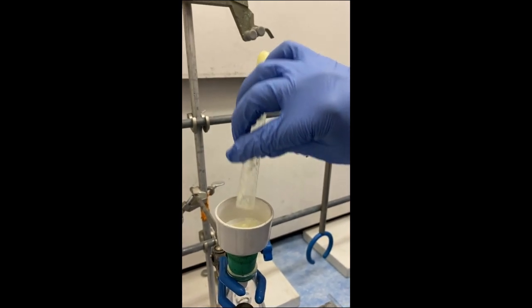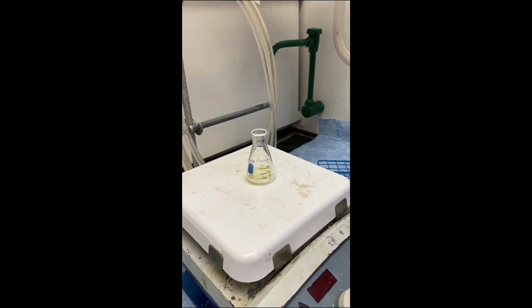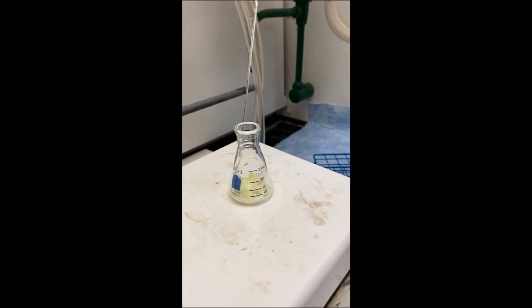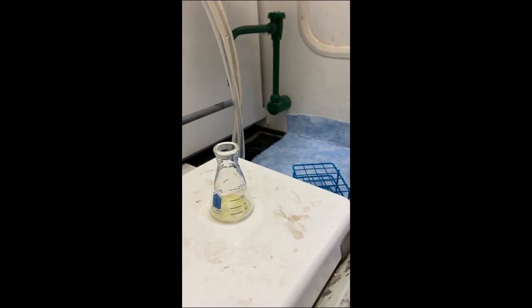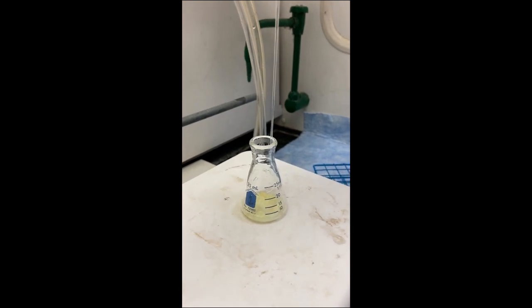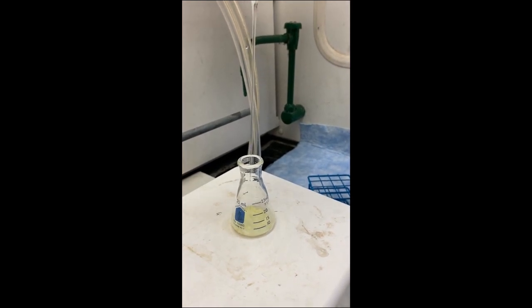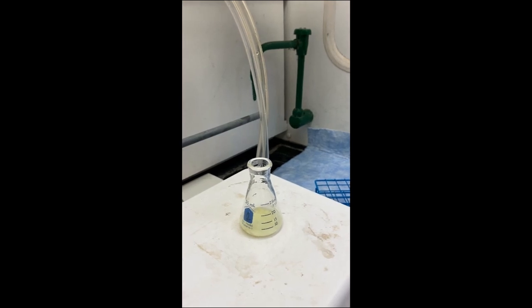Because it can go into solution. So we're going to start the recrystallization process — we're going to heat this up. Roberto's going to add some ethanol, probably close to a few mLs. Again, this is more art than science. We're going to heat it up, get it to dissolve, and then hopefully at the end we'll have some pure crystals.